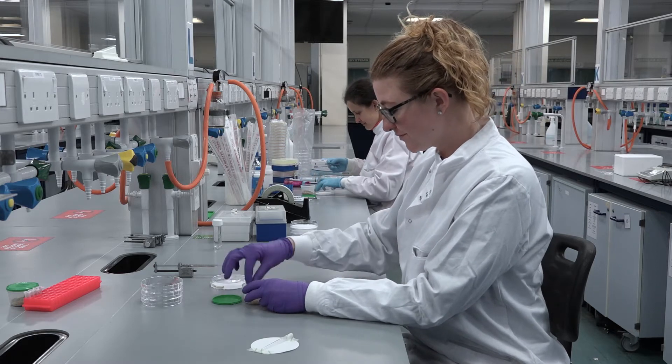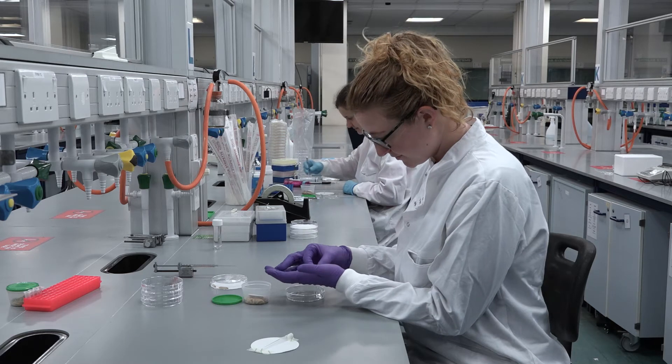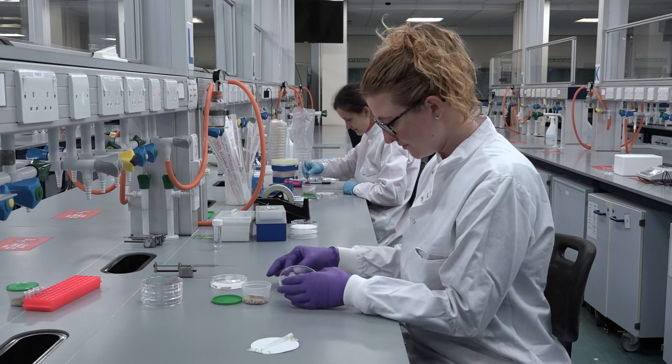Controls will vary depending on the nature of your experiment, but for every experiment, injection controls and no injection controls must be set up as a minimum.